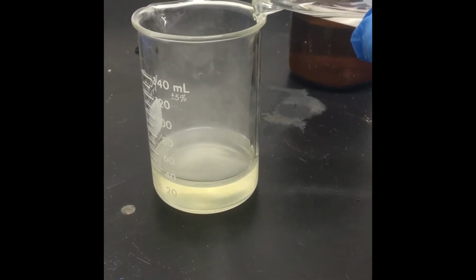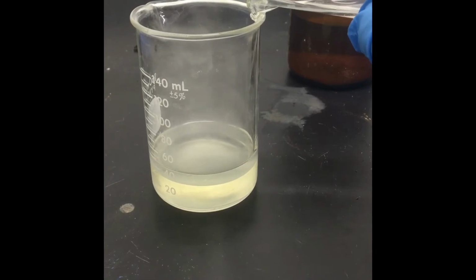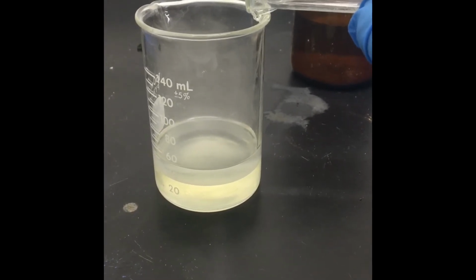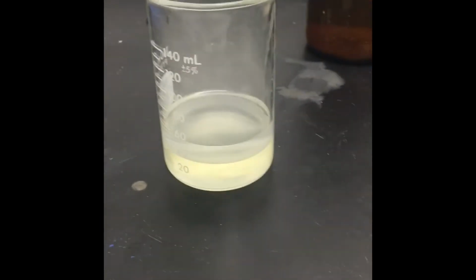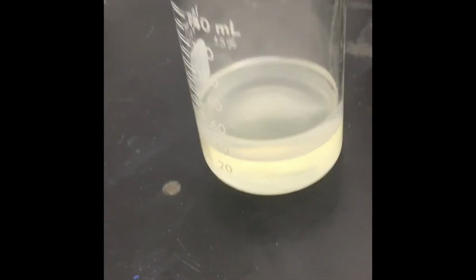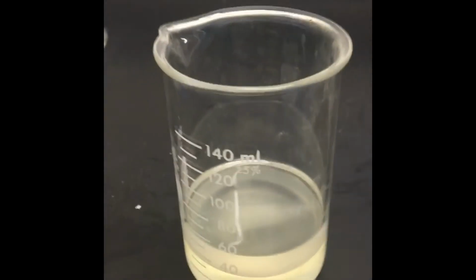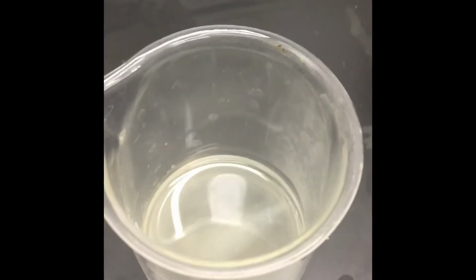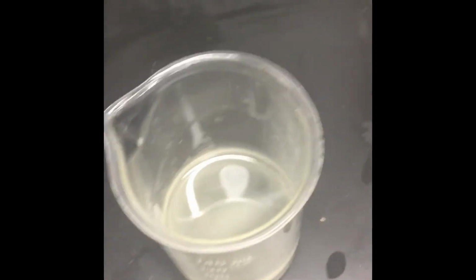You can see that the layer of the second compound is forming. Now I will tell you why I'm adding this super slow. I have about the same amount of each, so I should get close to 60 milliliters, more or less. Okay, so what you can see right here, I'm going to turn the hood on. What you can see right here is that we have these 2 compounds that I put in there. Now, one of the things that we will notice is that the nylon is actually going to form in the boundary between those 2 compounds. If I look, over here, you can probably see that there's some kind of solid that is forming right there. That solid is going to be our nylon.